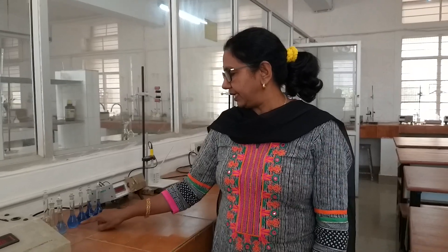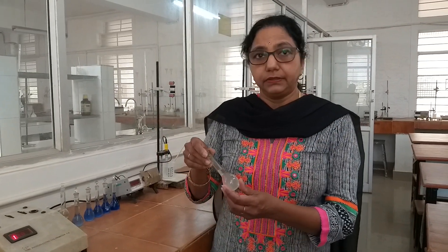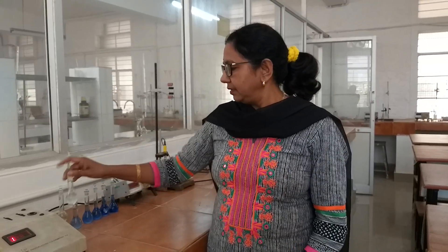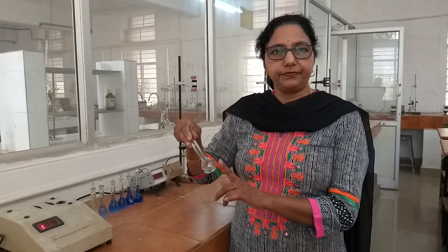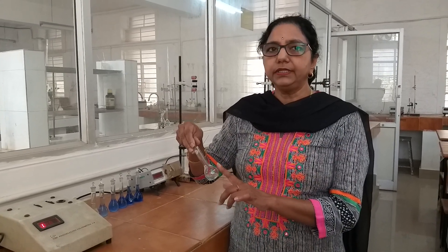The series contains 2.5, 5, 7.5, 10, and 12.5 ml copper sulfate. In one flask, I have prepared a blank solution that does not contain copper sulfate — it only contains 2.5 ml ammonium hydroxide and remaining water. After doing this, we will mix the solutions to make them homogeneous. The test solution is given to us in a small volumetric flask, to which we will add 2.5 ml ammonium hydroxide and remaining water, then mix it.